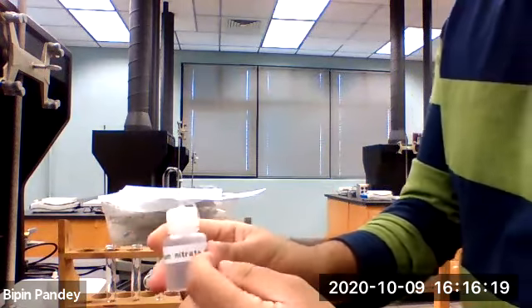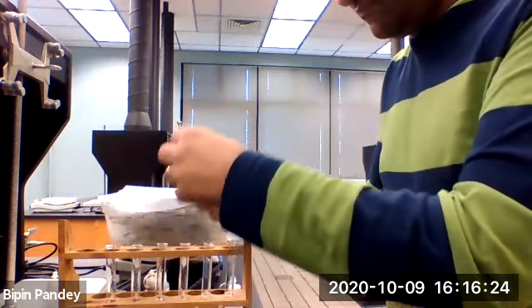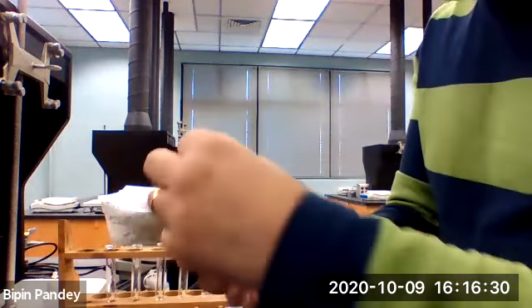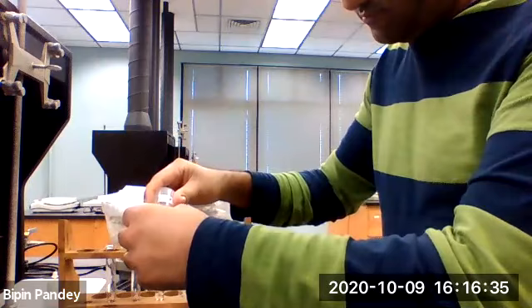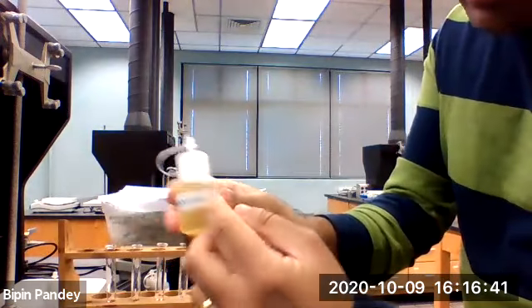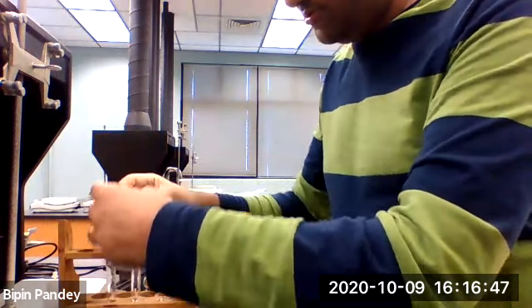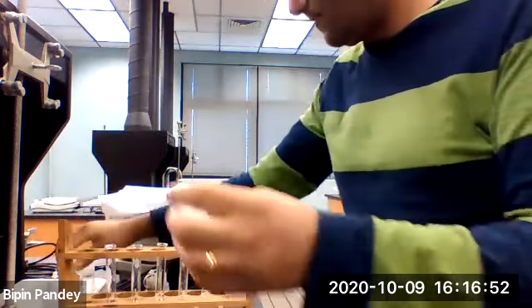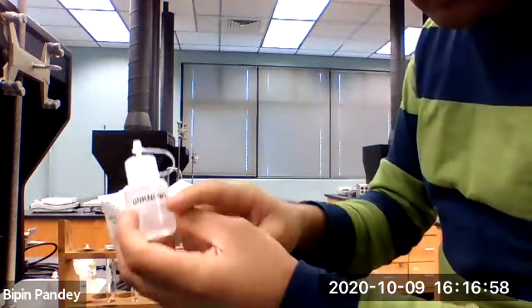Nitrate in the third test tube. Unknown A in the fourth test tube. Unknown B in the fifth test tube. And unknown C in the sixth test tube.